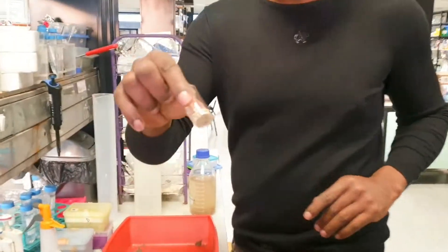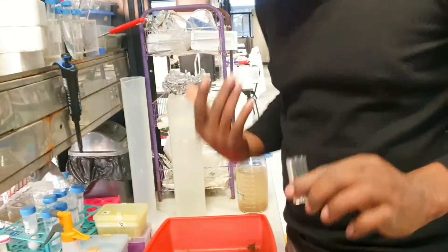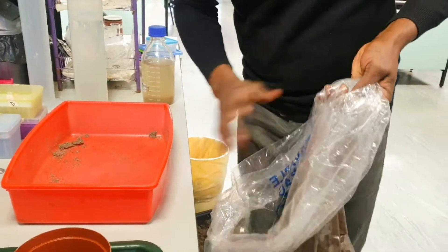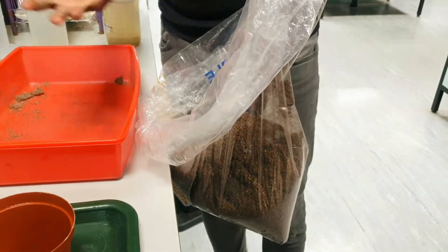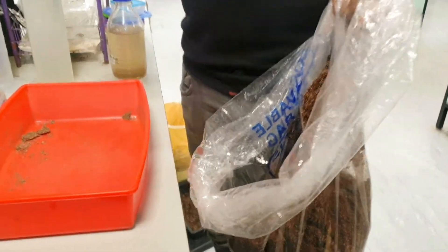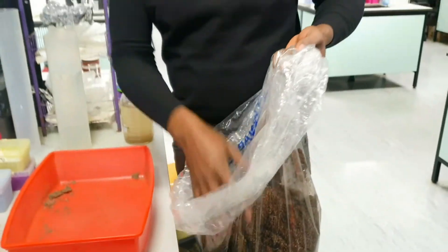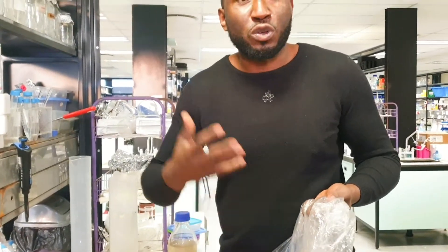This is the tomato seed, called Money Maker. It is widely used here in South Africa. First of all, this is my appropriate soil. I actually pasteurized the soil at 80 degrees Celsius — I don't go above 100 degrees Celsius. We started pasteurizing our soil after buying some that was contaminated with flies, to get rid of any flies that could interfere with the growth of the tomato.